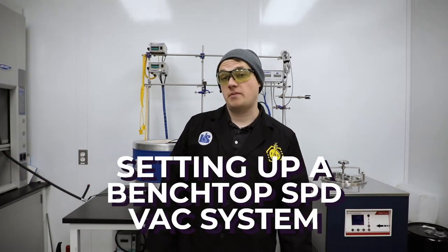Happy Wednesday. This is Mike with Lab Society and today we're going to go over how to set up a benchtop SPD vacuum system.